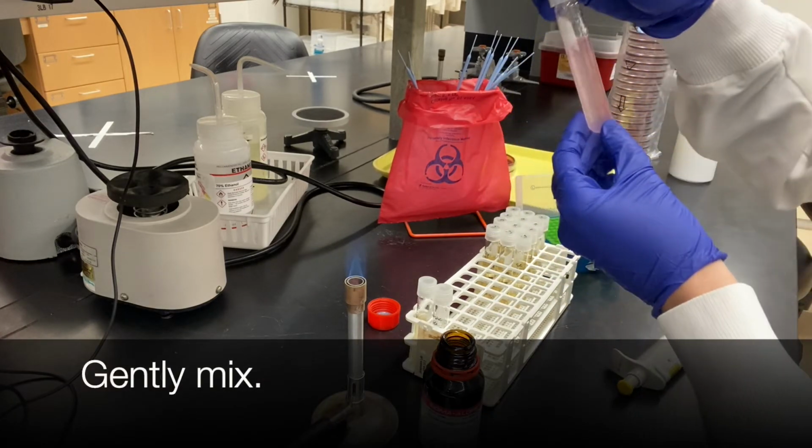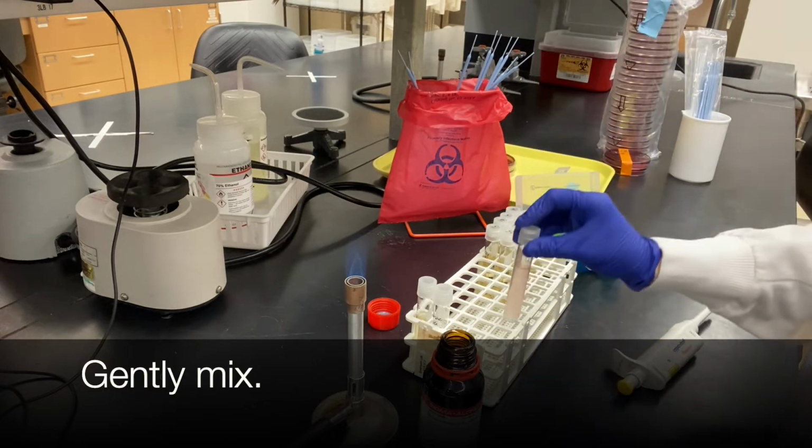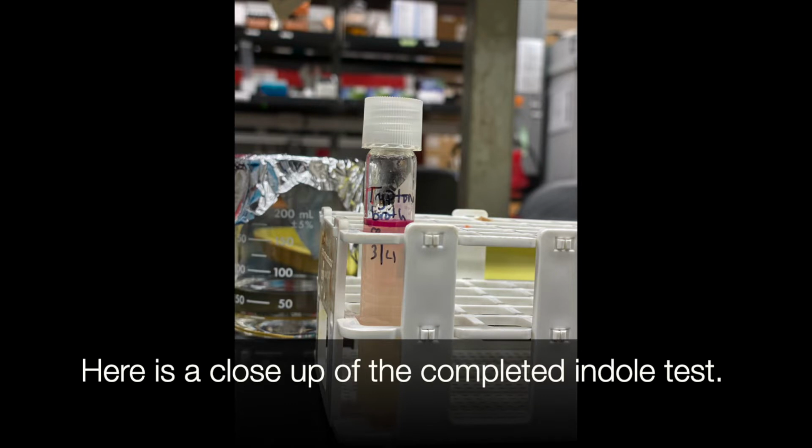Gently mix your sample. Here's a close-up of the completed indole test. For this experiment, we'll be on day 3, or 48 hours of inoculation.